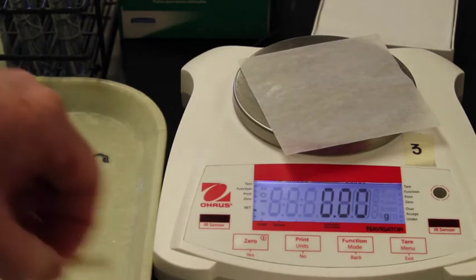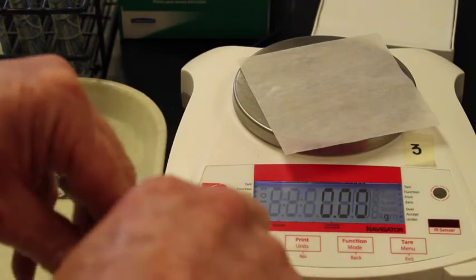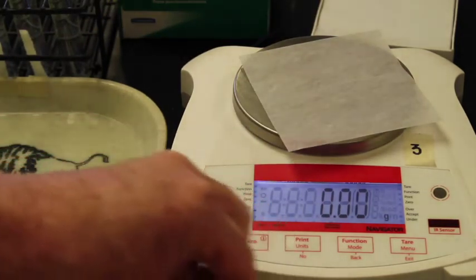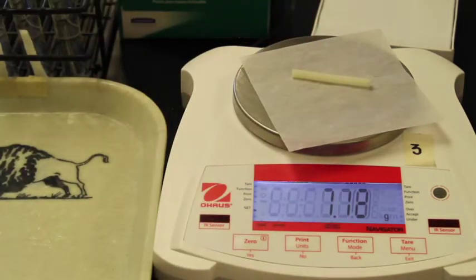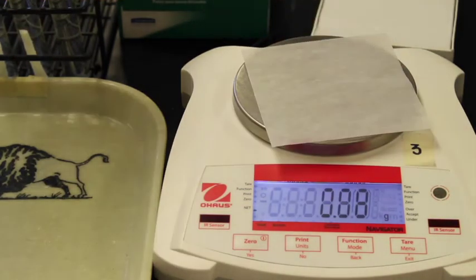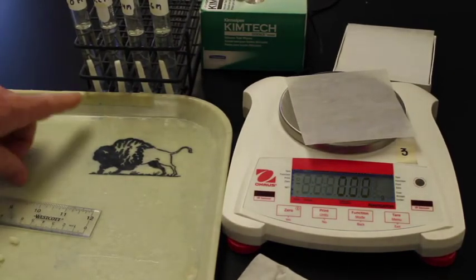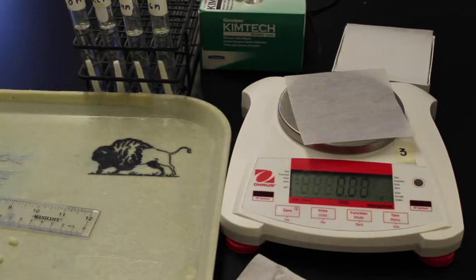I'll put the next one in the 0.2 molar. Then I'm going to blot the third one. We'll mass that one. You can record that in the manual under the 0.4 molar. And then I'm going to blot the last one and mass it. You can record that one in your manual under the 0.6 molar. Okay, so now I've put all the potatoes in these solutions. They're going to sit for 30 minutes and then we'll go in and mass them at the end.